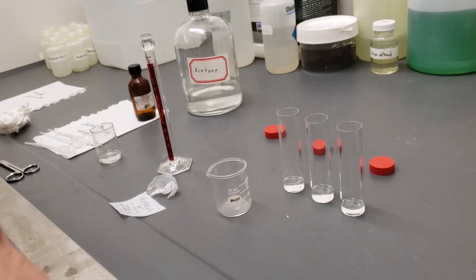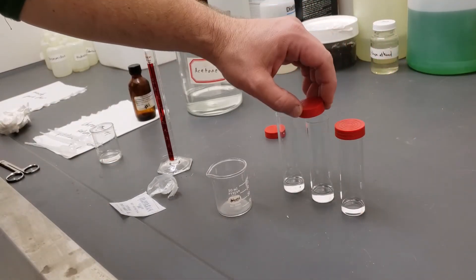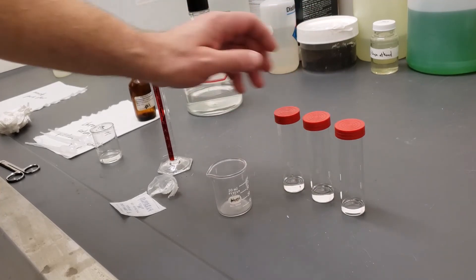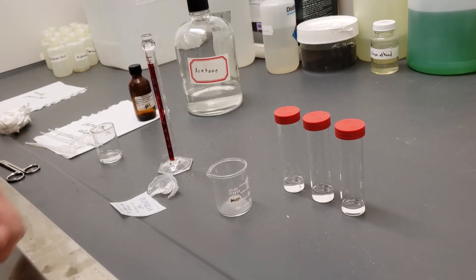So I've got some solution, my nine to one in each chamber. I'm going to put the lid on there to try to reduce the evaporation until I bring my chromatography paper over. And that's it.